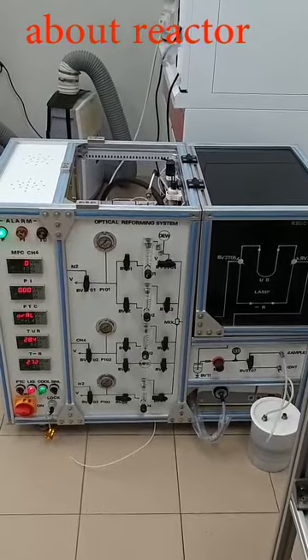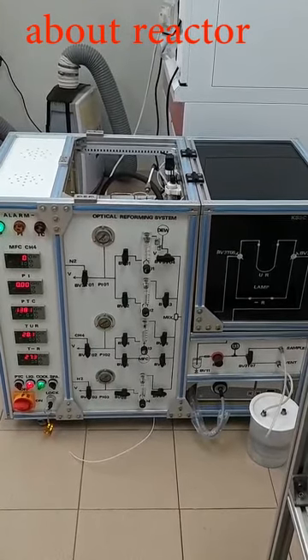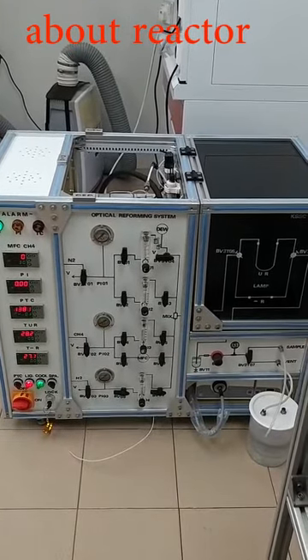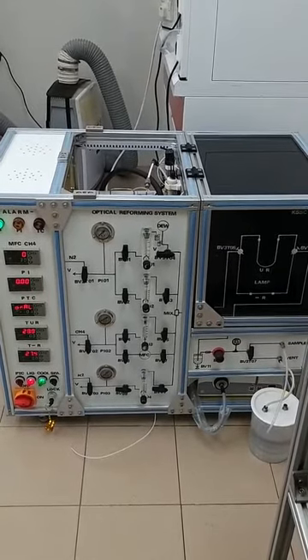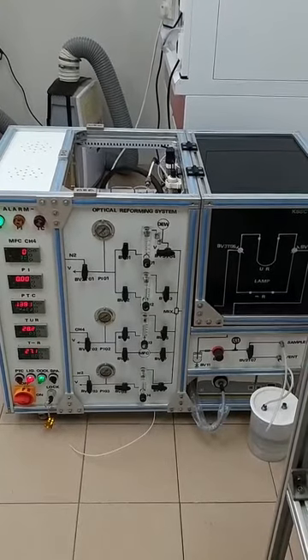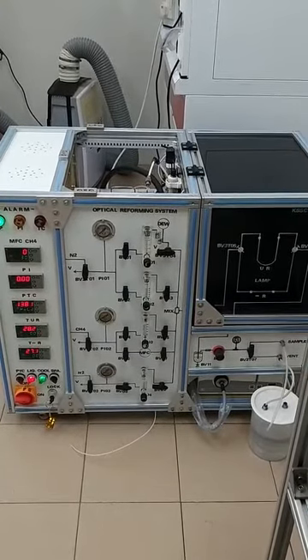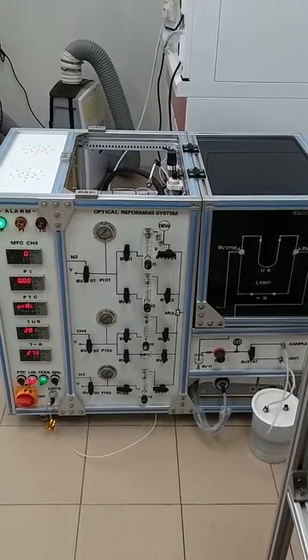This instrument is designed and fabricated for methane reforming under the optical condition with a visible range. And today we will introduce this instrument to be used for other reactions with gas and steam generation.